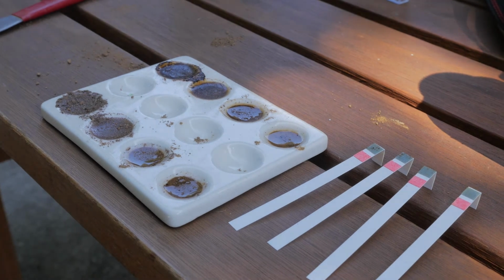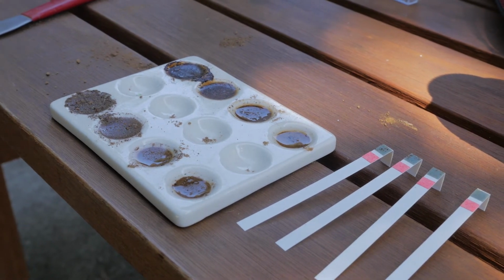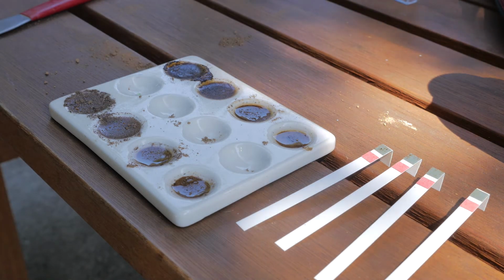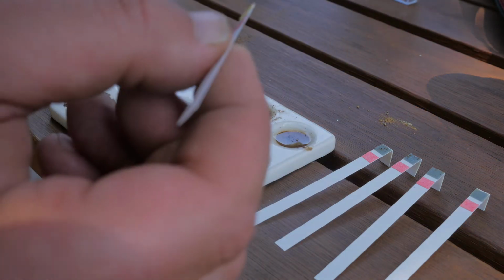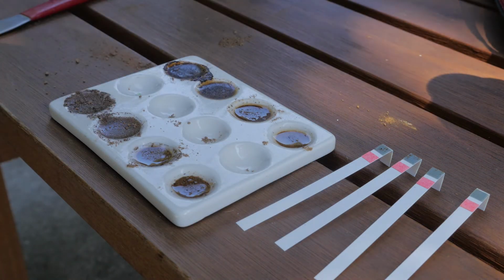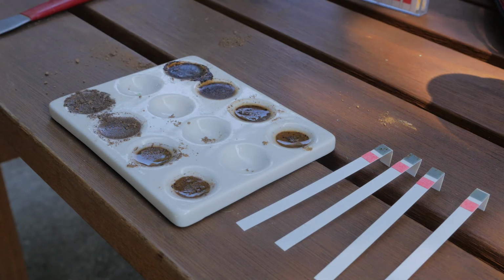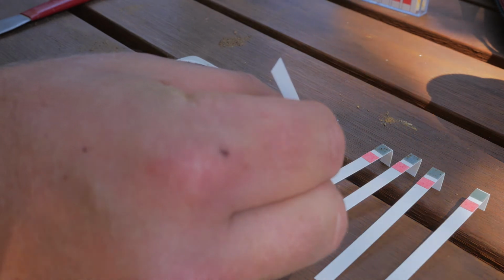Now we're going to test. Tell me when you're hitting record. Yeah, we're recording now. We did our first in 1-to-1 water. We're not getting a lot of reaction on those, so I'm going to have to go back through. Now we're going to do the alpha-alpha dipyridyl if it's over 9.5. We're going to use the yellow strip, the first strip, because that's reactive in that 9 to 10 range. So we'll do this first strip.